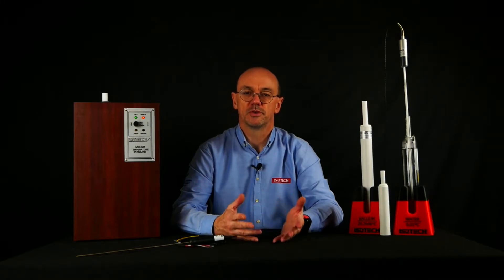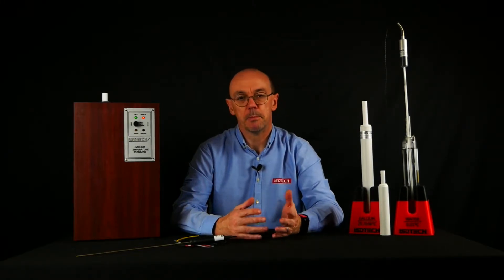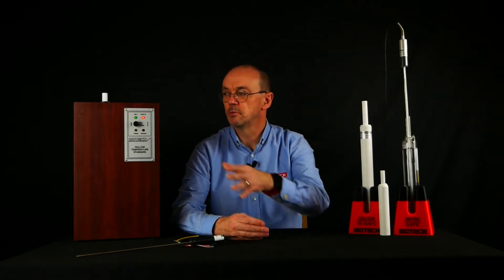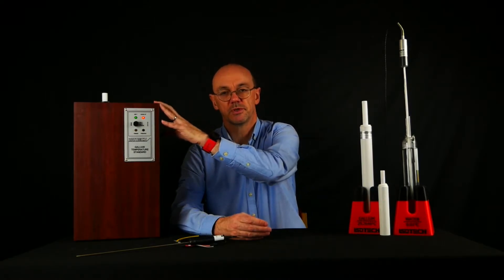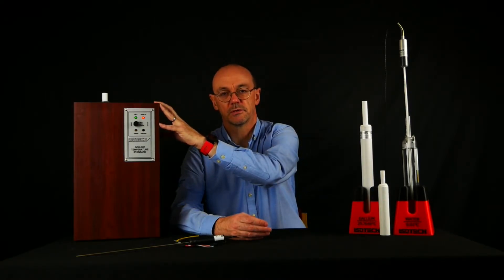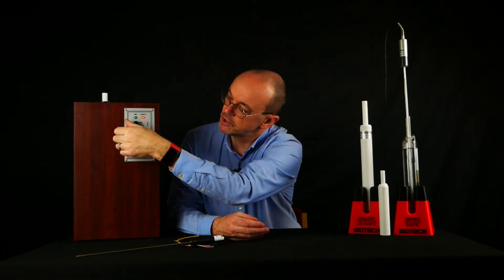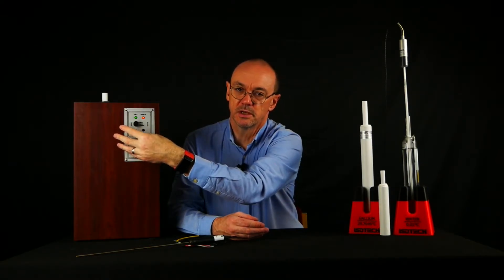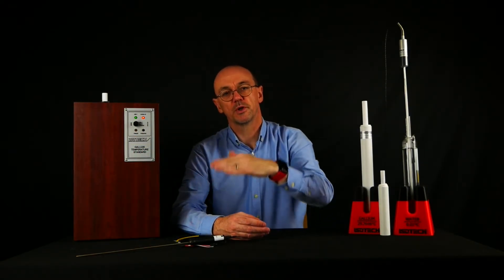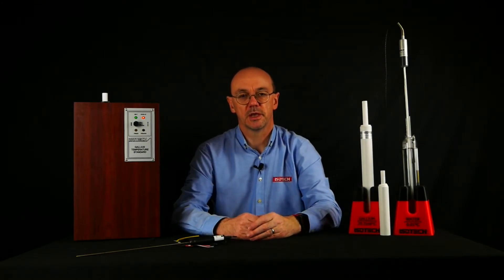At the end of the process, the metal will all become liquid and will rise to the same temperature as the apparatus. Then we can simply turn the switch back to freeze and the cell will be cooled from the bottom up, ready to be used the next time.